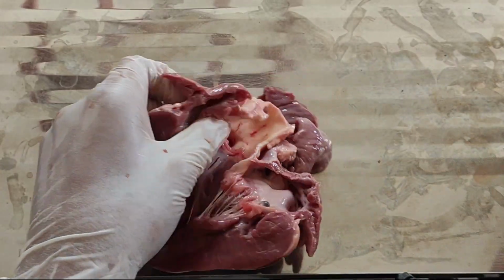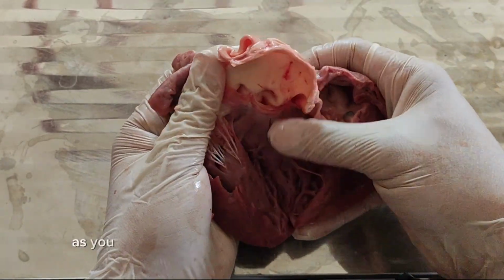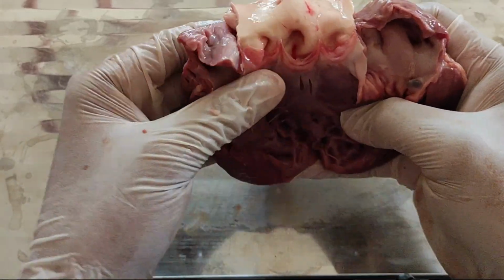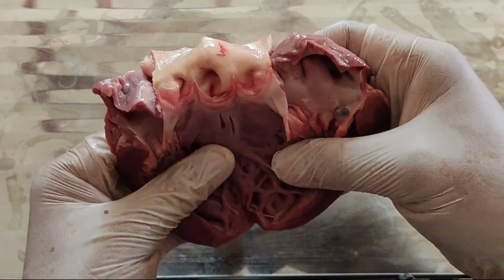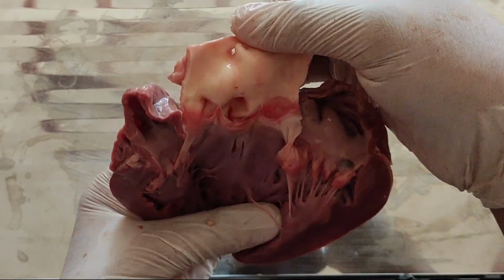There. Cutting complete. As you can see, we have here the aorta cut open. See here, everyone, the aorta. This is the aorta. Now let us examine it on the inside.